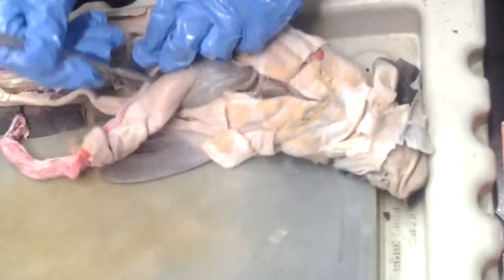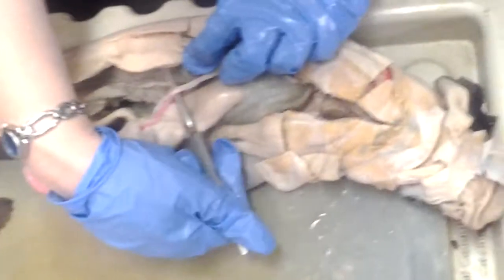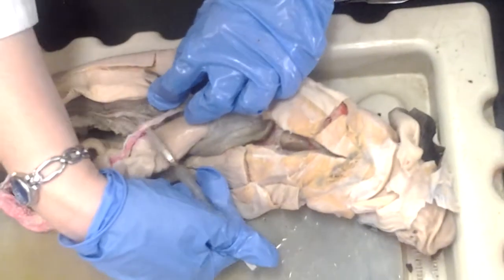And somebody asked me about the gastrohepatic. Yes, so let's look at that. We need to know that the hepatic portal vein is with it too, right? And the bile duct, and what else? And the celiac artery. Yeah. Hepatic artery. So, here is the... The celiac is outside. Yes. What's this called?